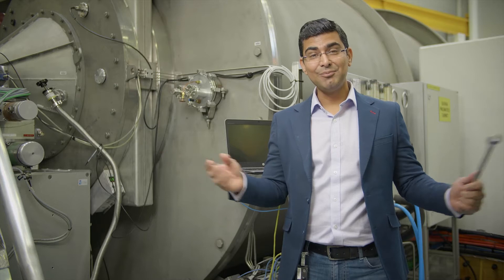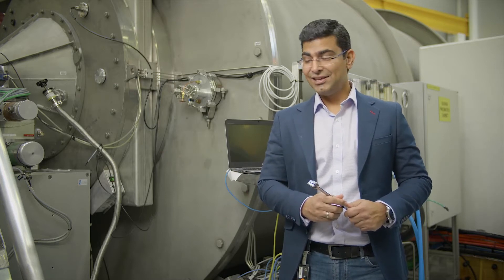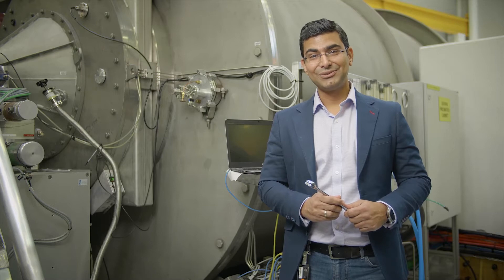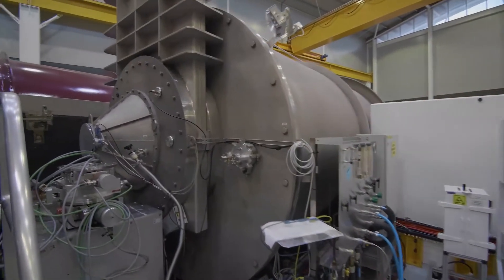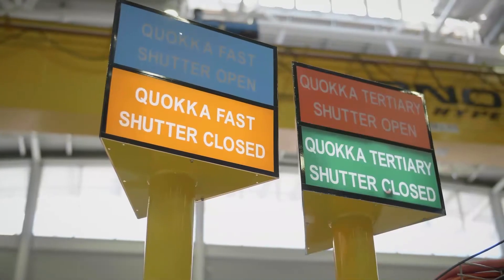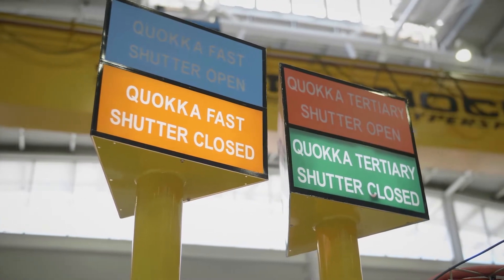Hi, I'm Jitendra Mata. I'm an instrument scientist here at the Australian Centre for Neutron Scattering at ANSTO. I study nano and microstructure of materials using this amazing instrument called QUOKKA, a small angle neutron scattering — SANS — instrument.